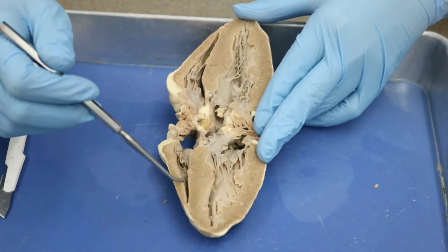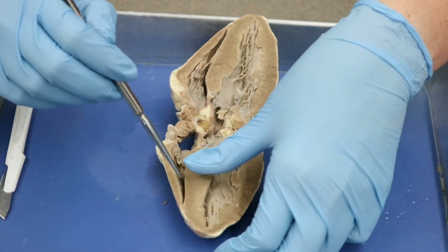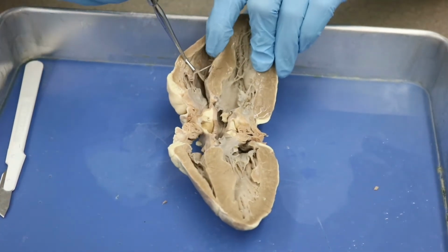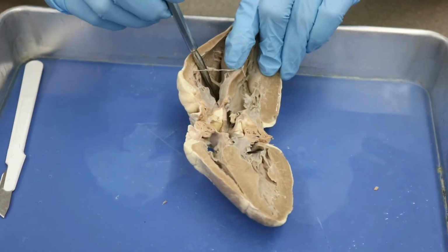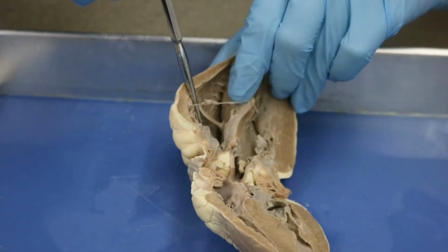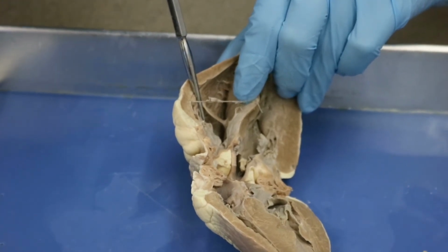Okay, so then we need to go from the right ventricle, and let's see which side has the opening. Looks like this side up here has the opening. So if I kind of tilt this, you can see that this goes down deeper this way. Okay, so the septum here is covering it up, but when you pull it back, you can see it goes down pretty deep.